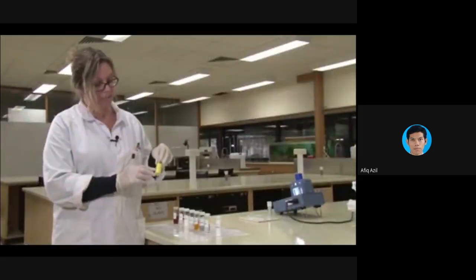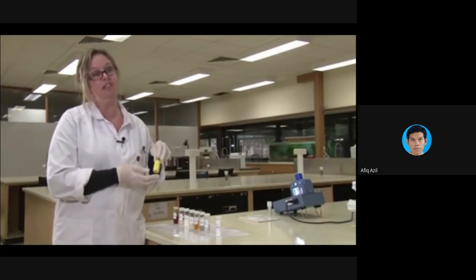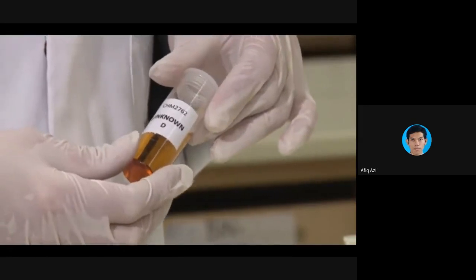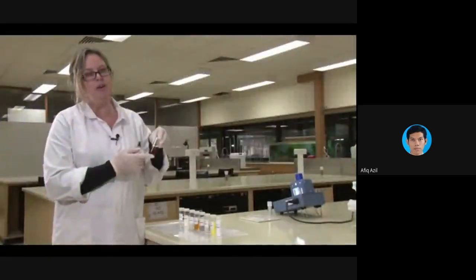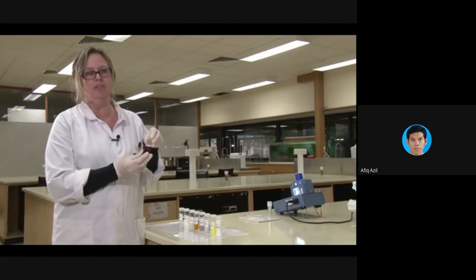For solids and liquids, you can often tell by the colour what sort of functional groups are present. Ketones, diketones, quinones, and conjugated species all can be yellow, orange or red coloured. Phenols are usually quite dark coloured, like this one. Sometimes though, organic compounds go off in storage and they become quite dark as they oxidise, so you can't always tell exactly from the colour.